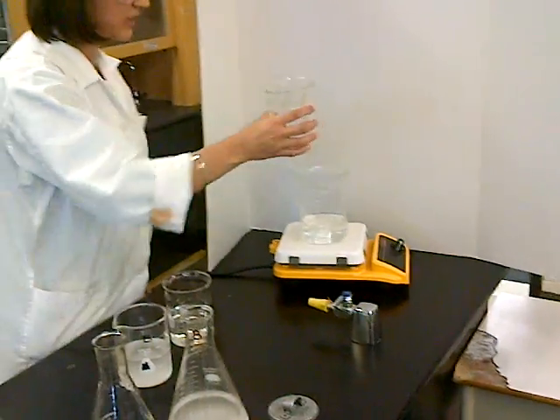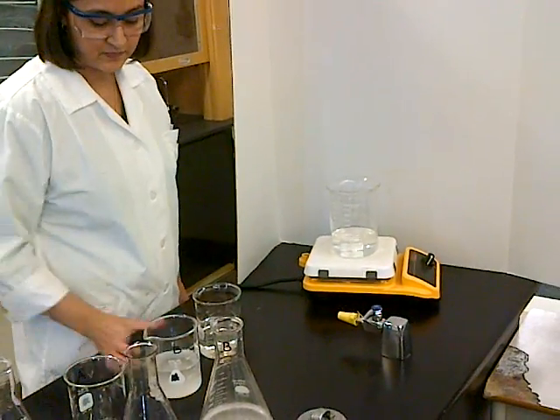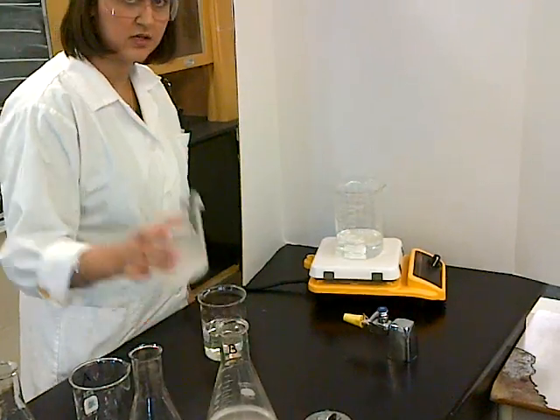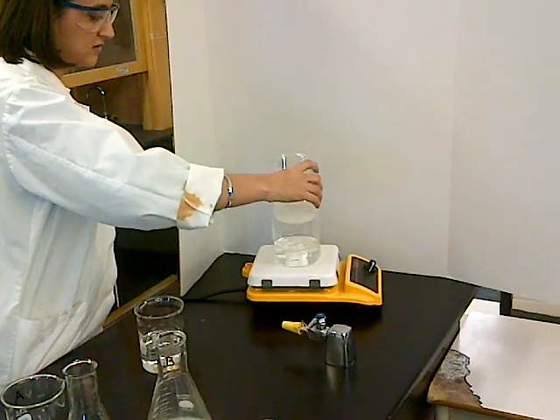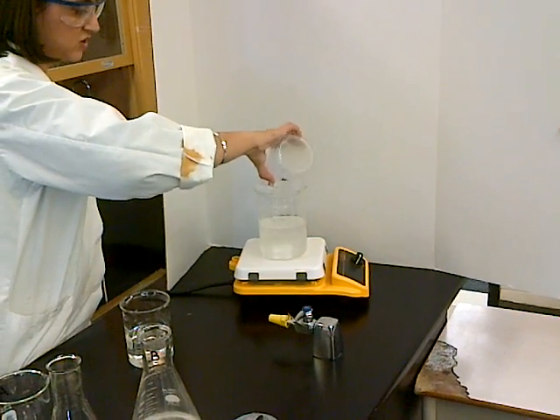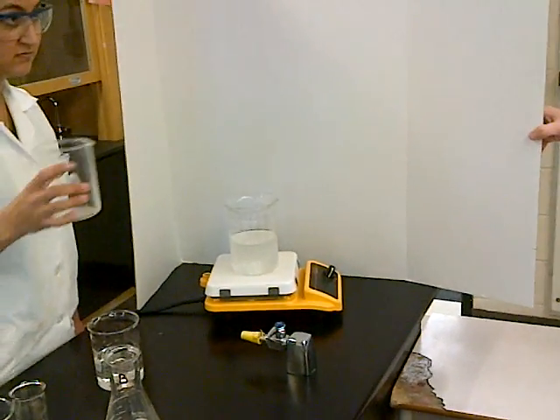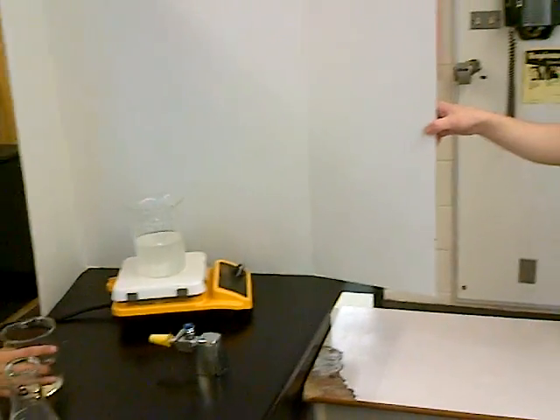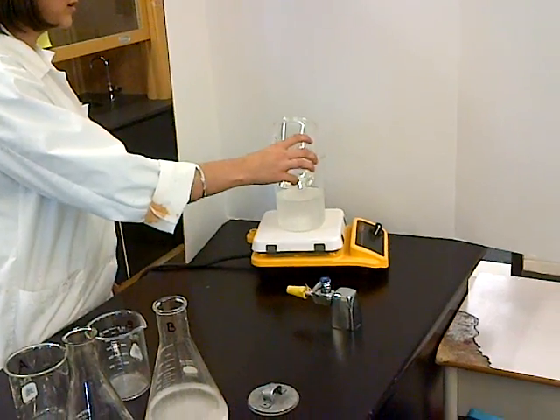This is A — this has malonic acid, sulfuric acid in it, and the KIO3. And this has, as you can see, starch. Here's the starch part, and the starch indicates what again? The color of the reaction. And this is the peroxide, the one that will bleach everything.